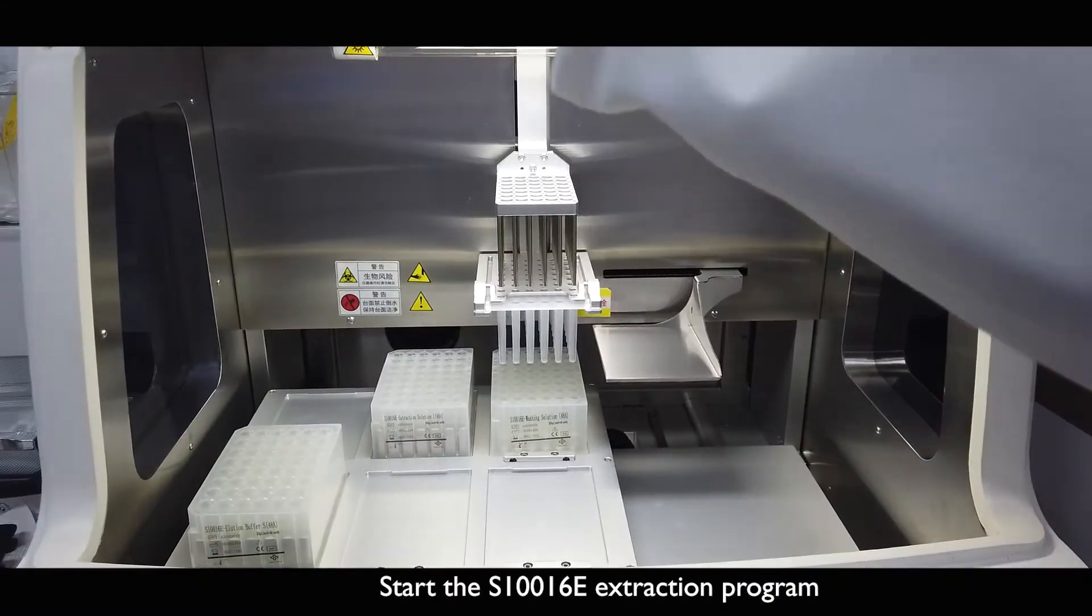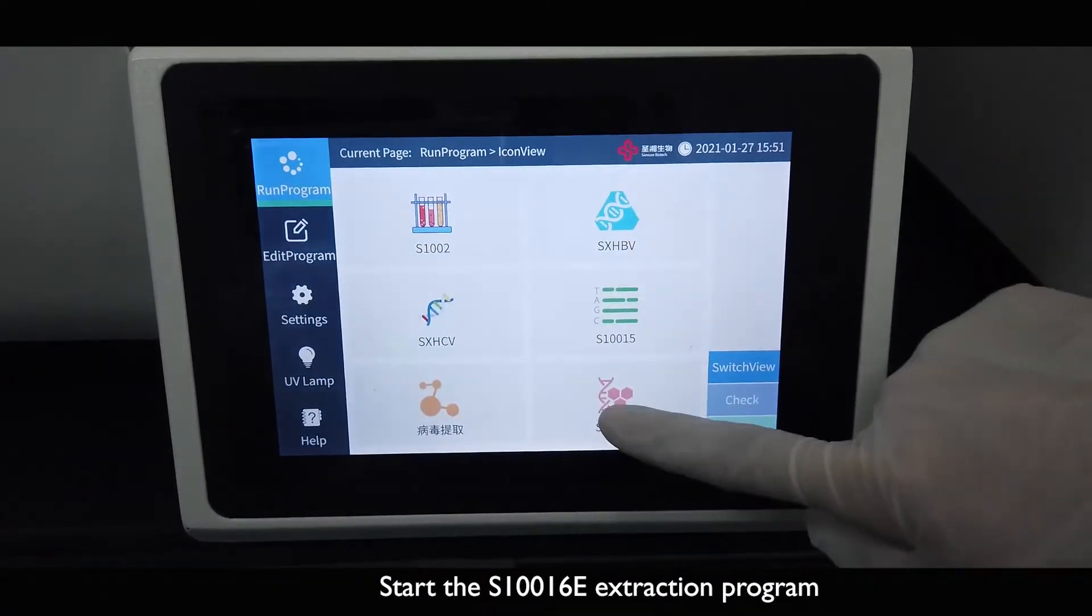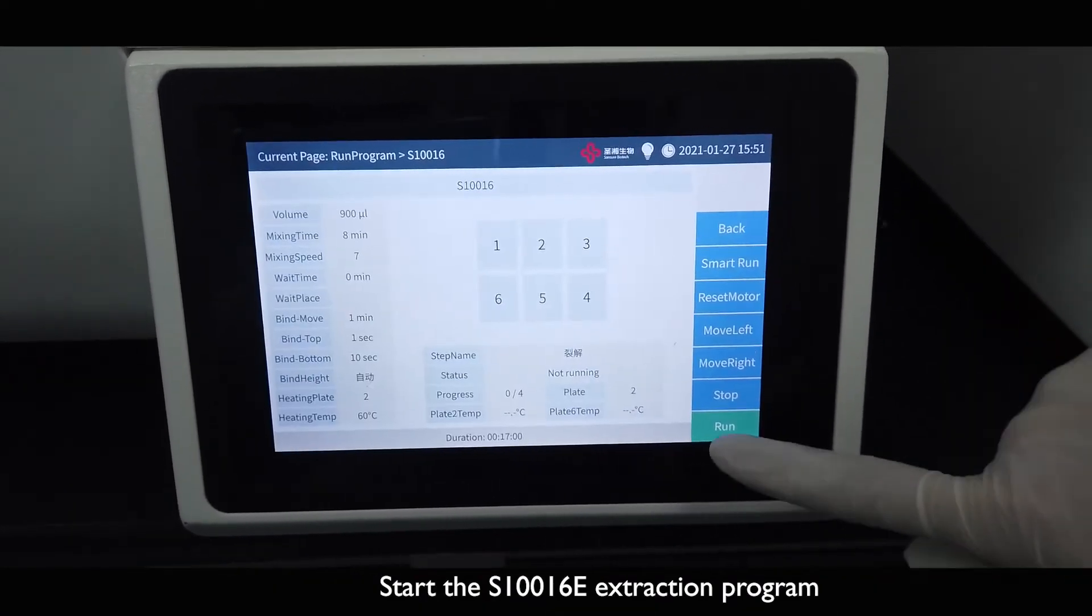Start the S10016E extraction program. When Natch 48 is running, we can prepare the PCR master mix.